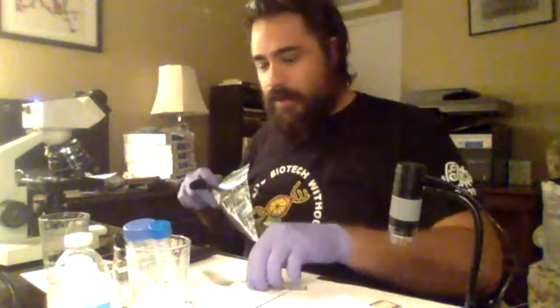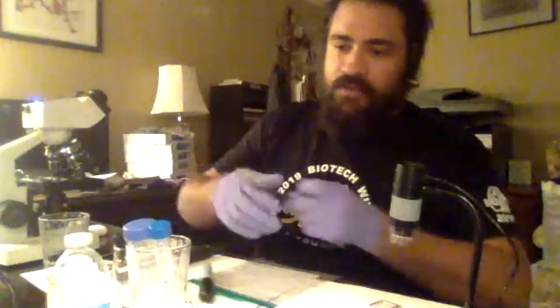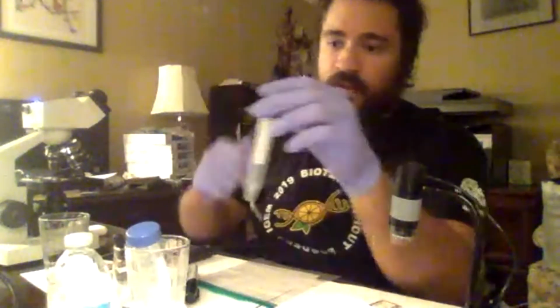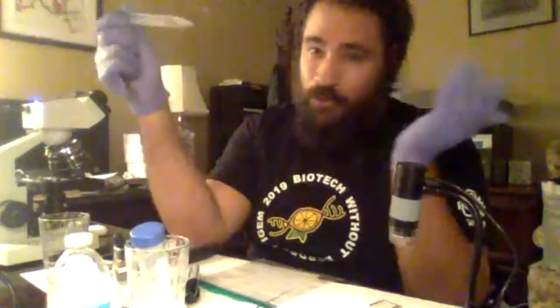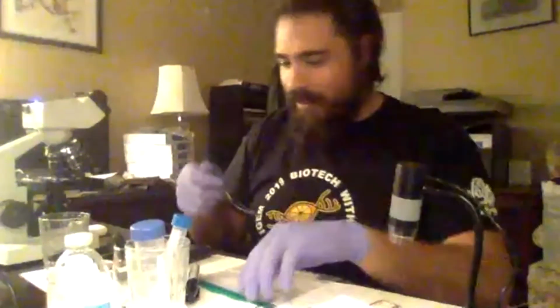So that's really important. A little spoon is going to help us understand how much we can put in. One nice thing about it, 1 milliliter of volume is roughly equivalent to 1 gram. So gotta love the metric system.